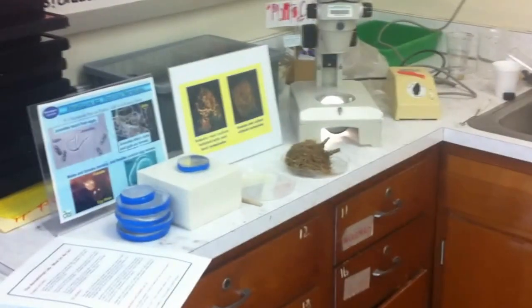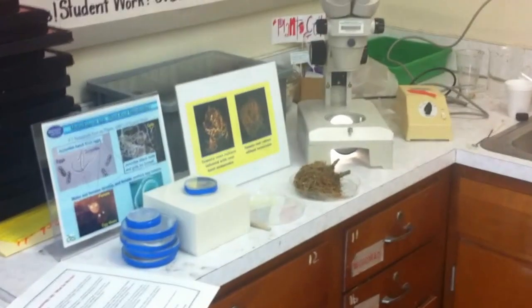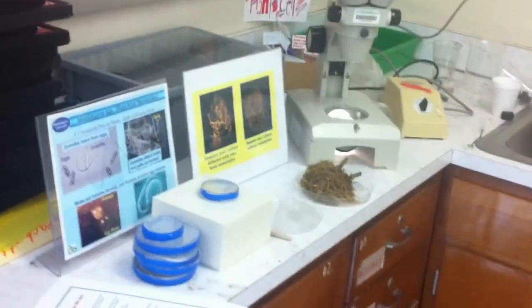Alright, we have a really special lab here for Station 2 of the plant pathology lecture for TapRoots. Essentially, students will be discovering nematodes as a sign of plant diseases. So one of the signs that they'll be investigating are root knot nematodes, which cause this root ball to form here. And follow the pointer here, but essentially, zoom in, we have the roots.